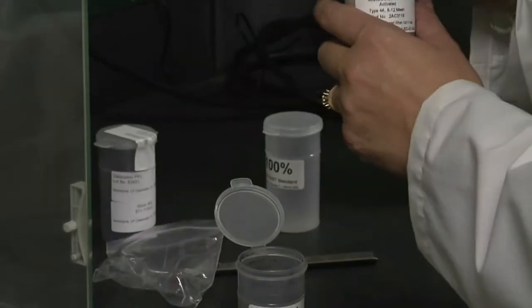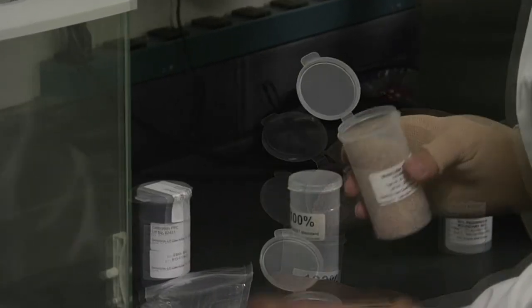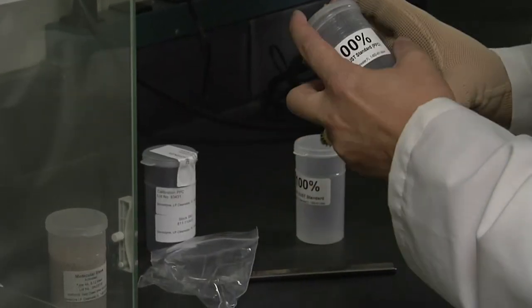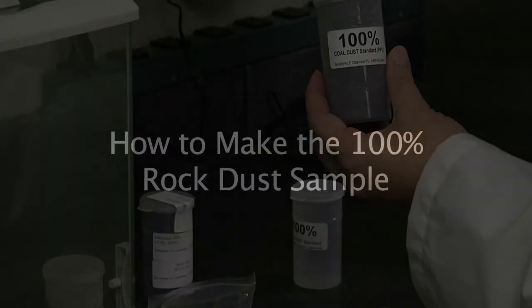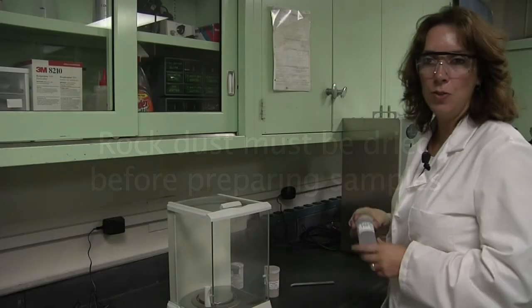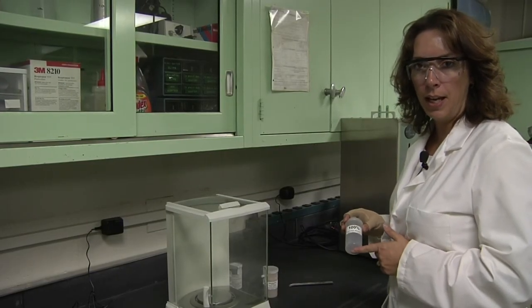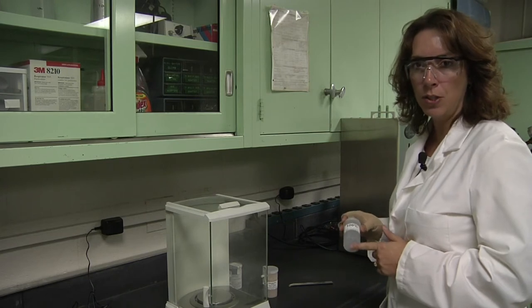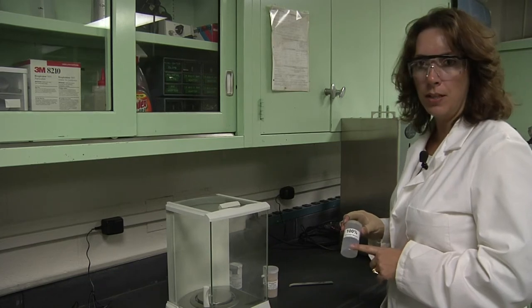You can also add some sieves to ensure that the PPC sample remains dry. To create your 100% rock dust sample, simply take a dried portion of your rock dust that you are using for that mine and put it in the container.